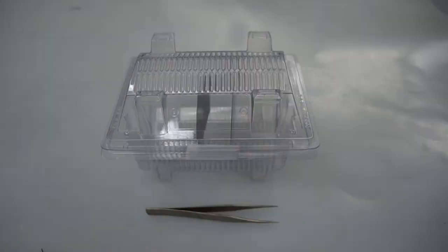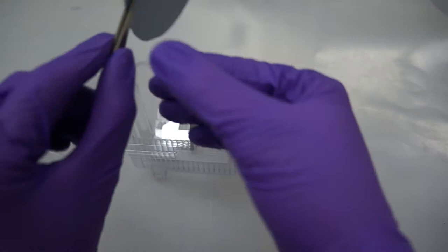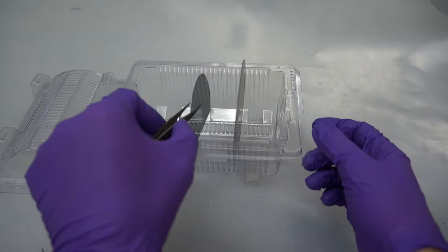Now that we've completed making our polymethylmethacrylate solution, we can begin cutting and cleaning our silicon wafers. It's important to note when working with silicon that the dull side is the part where we can score and cut on, and the shiny side is the part where the thin film is going to go. So it's always important to protect the shiny side of the silicon wafer. Since we've already used part of this wafer, we can cut today's samples from this piece of silicon.